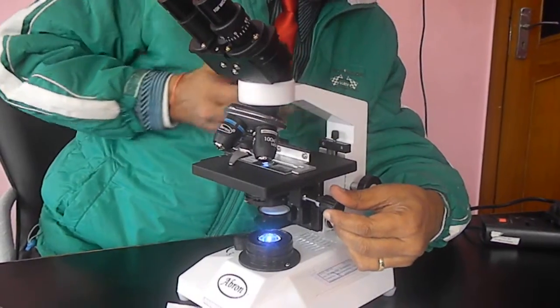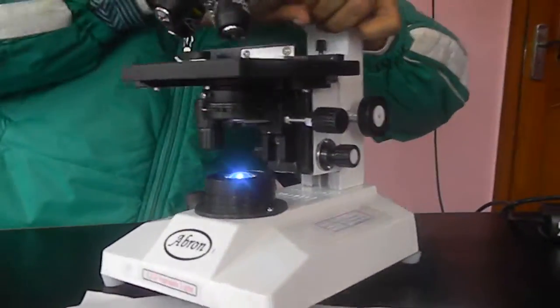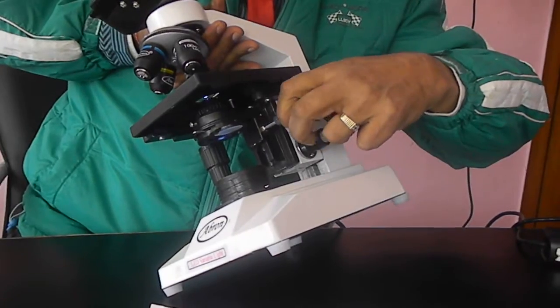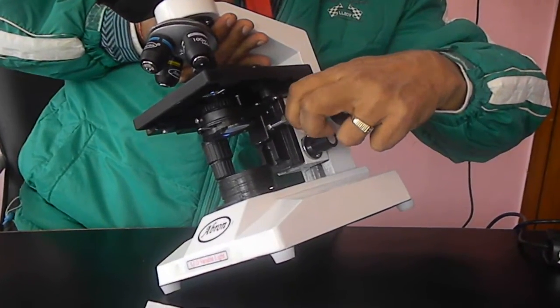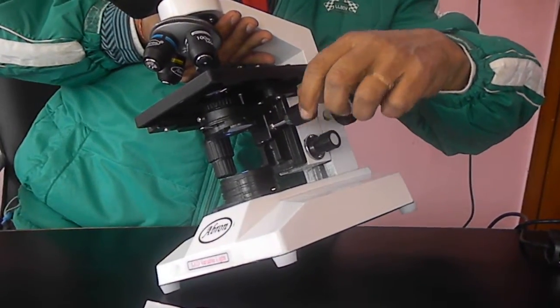And then there is one condenser, this condenser setting. It moves, you see, this moves the condenser up and down. Adjust so that the maximum sharpness is there of the subject.